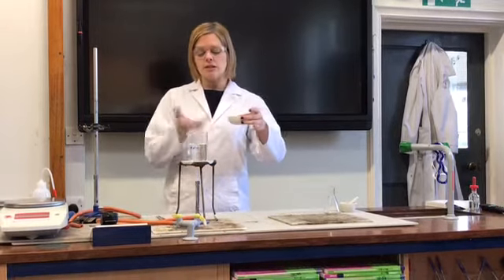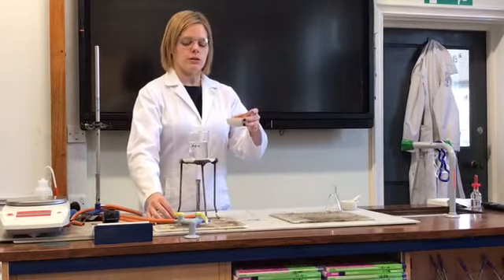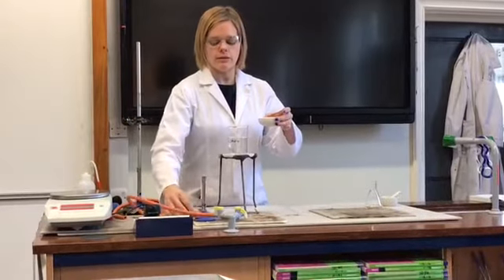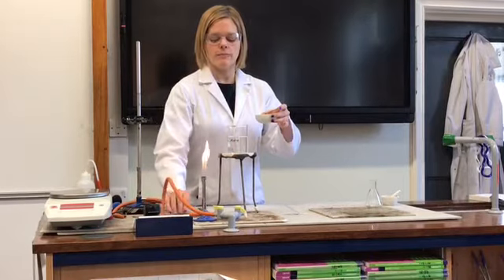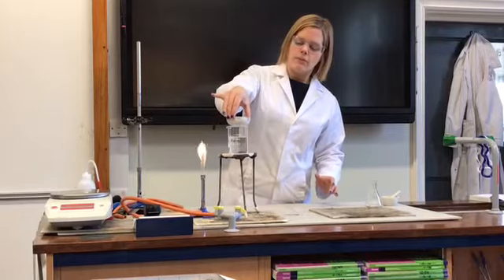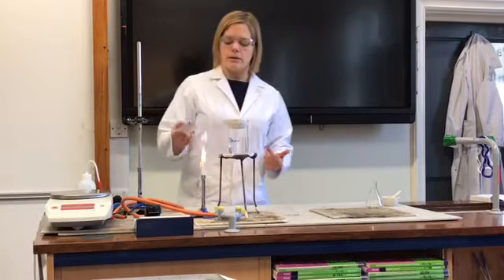I'd very much like to heat this up to evaporate some of the water, but to do that in a controlled way I'm going to use something called a water bath. I'm just going to stop heating temporarily, move that across, put that Bunsen burner on an orange flame, so that I can carefully come across and pop that evaporating basin on top without burning myself.